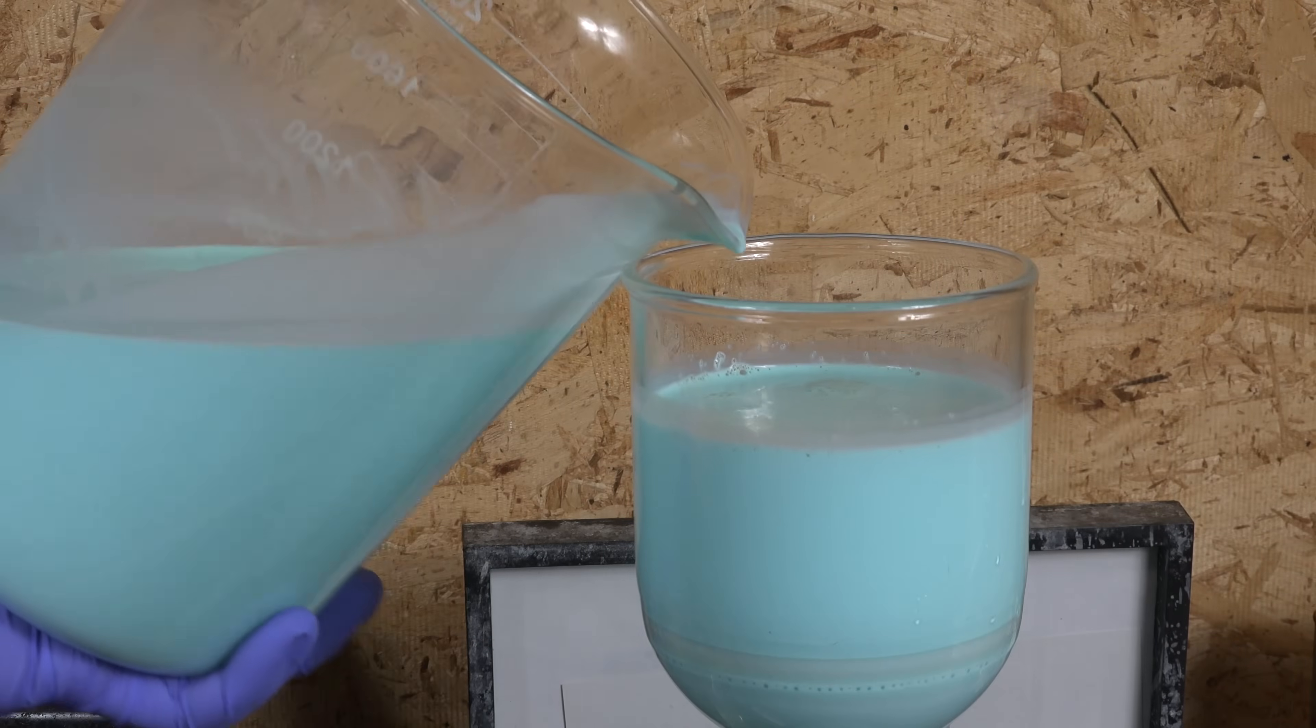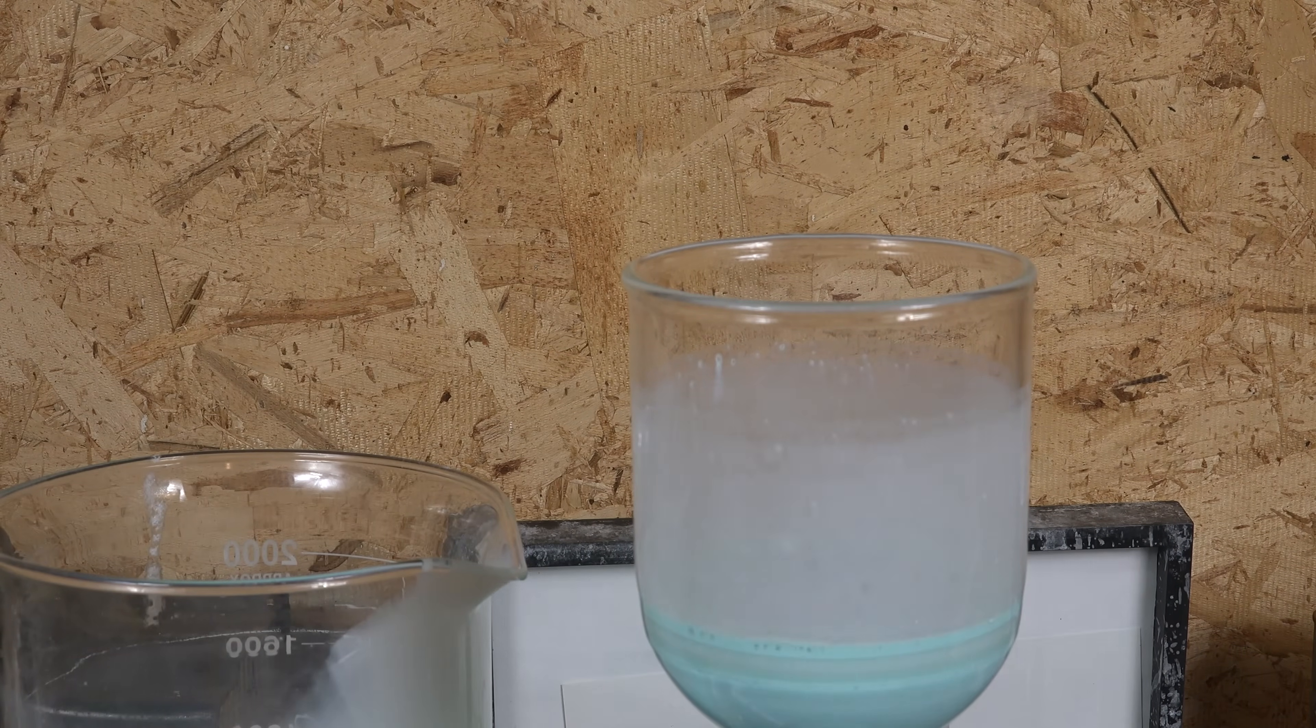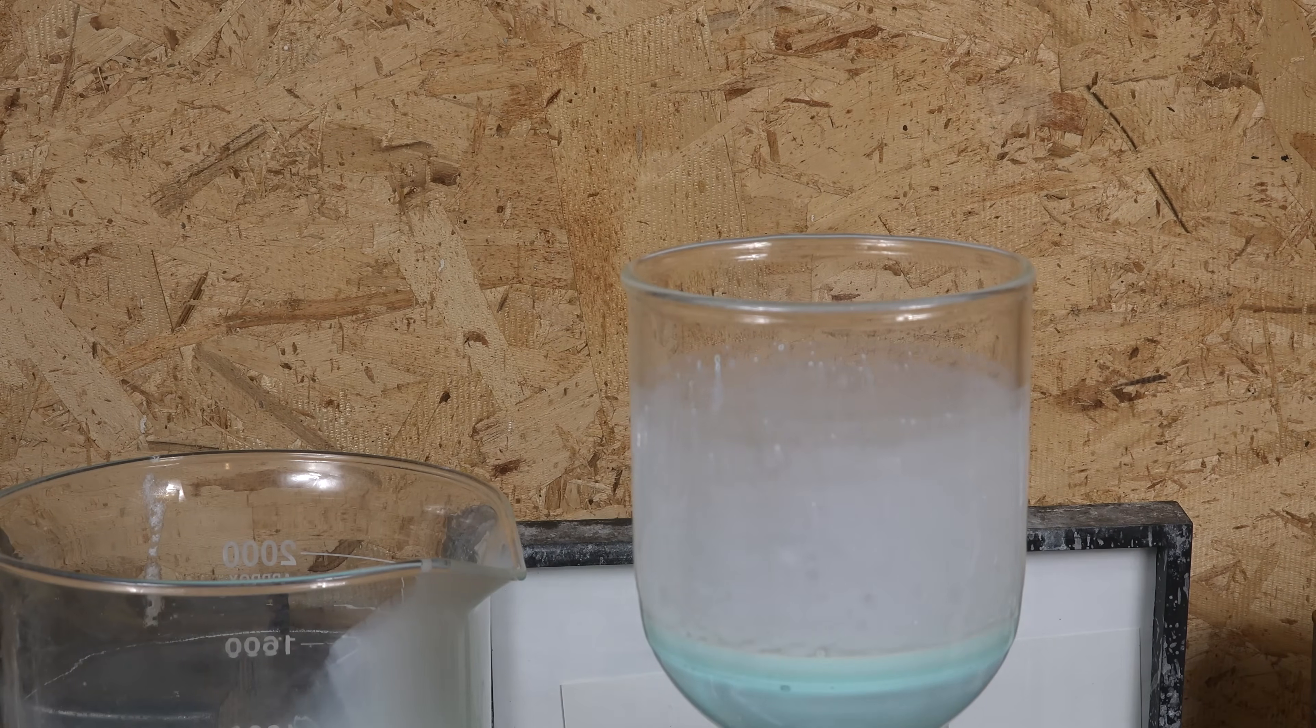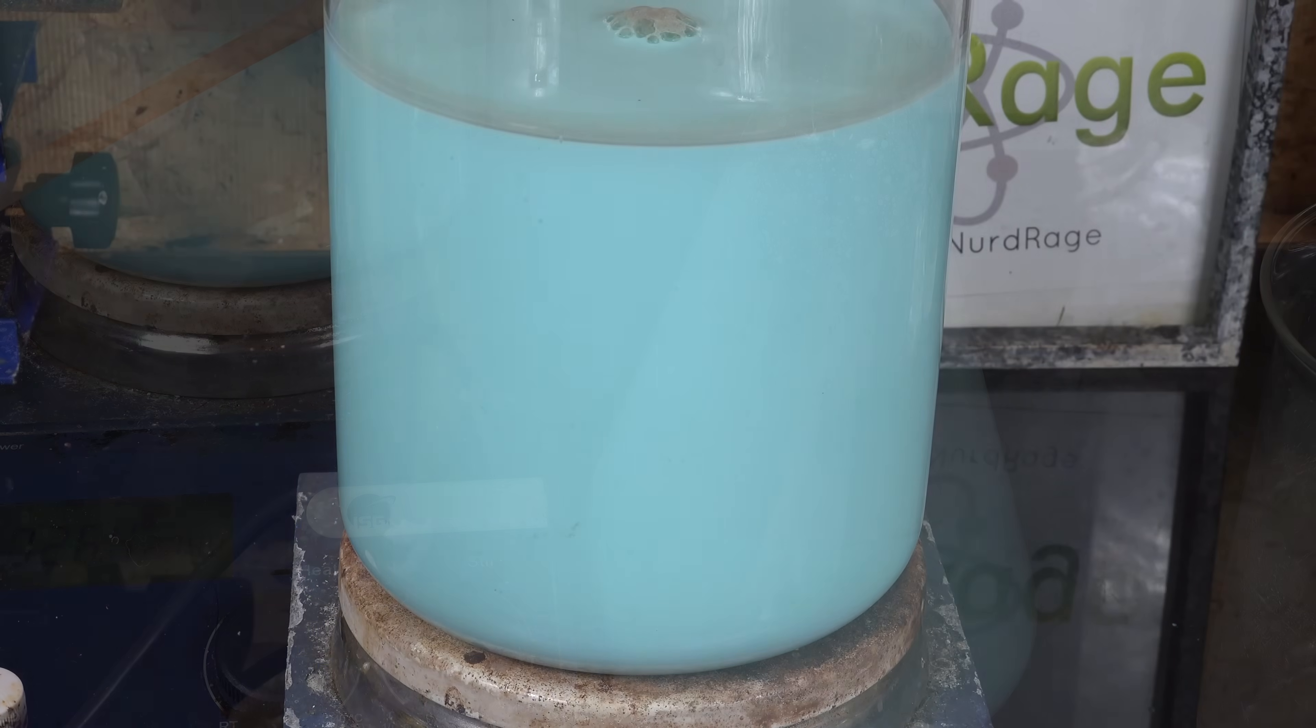Unfortunately when I tried to filter it the copper oxalate was so fine that it passed right through. It's like trying to filter milk. Although it looks closer to Star Wars blue milk that Luke Skywalker drinks.